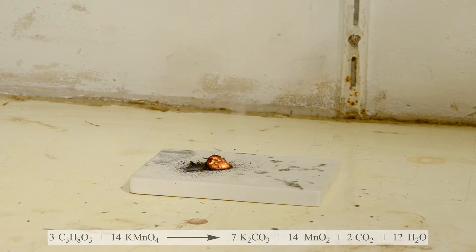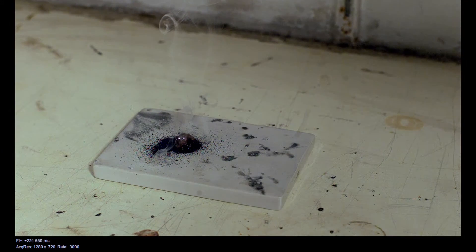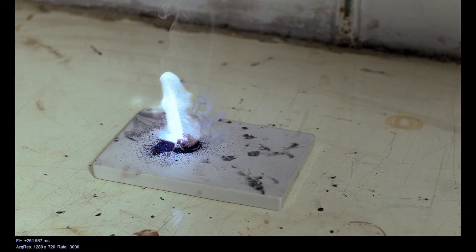This doesn't look as spectacular as the first one, but if you want to start a fire in a chemical and cool way, it works as well. And it's way easier.